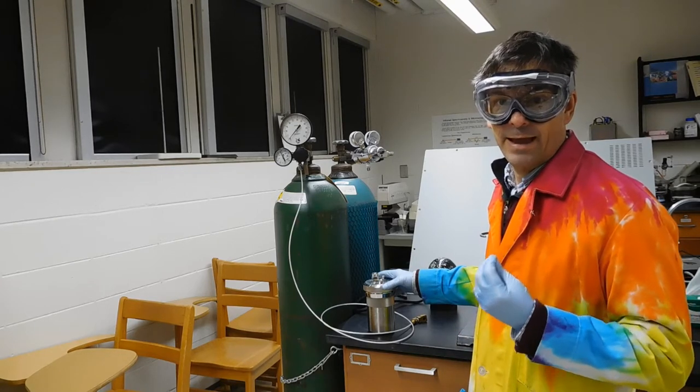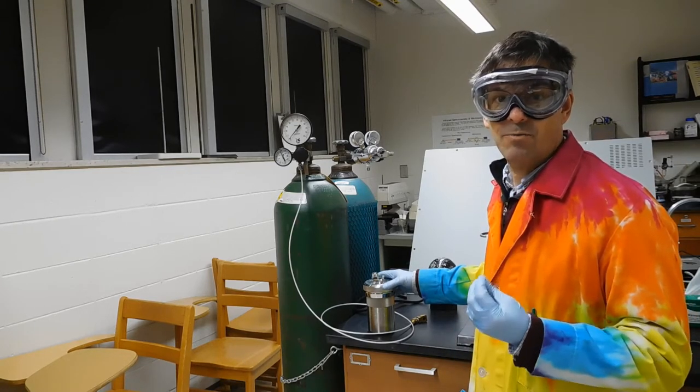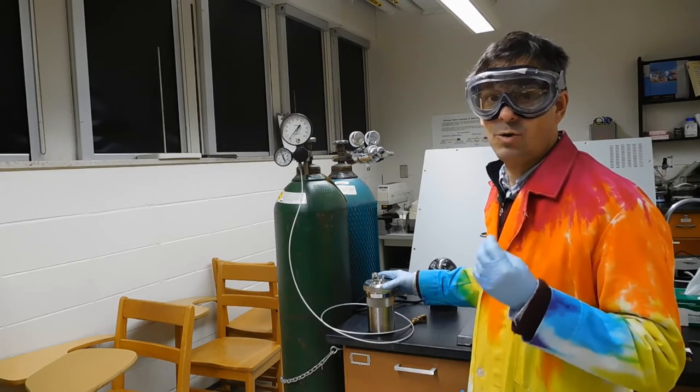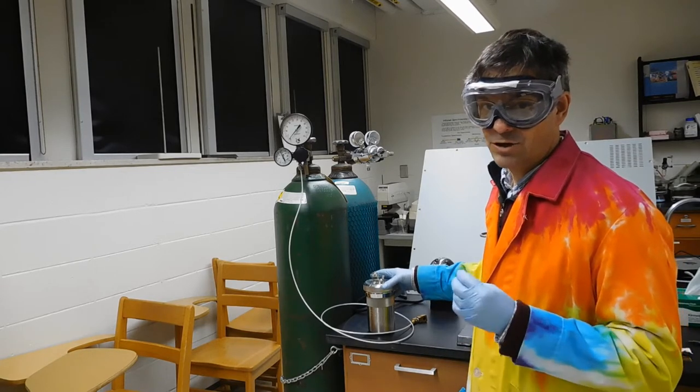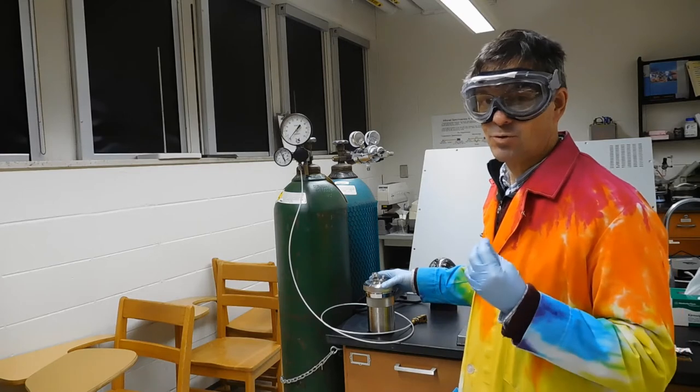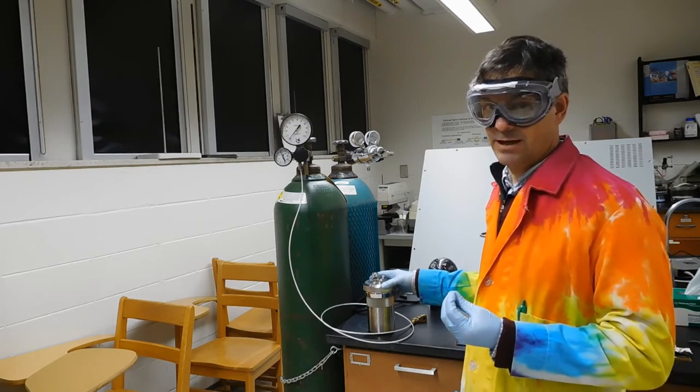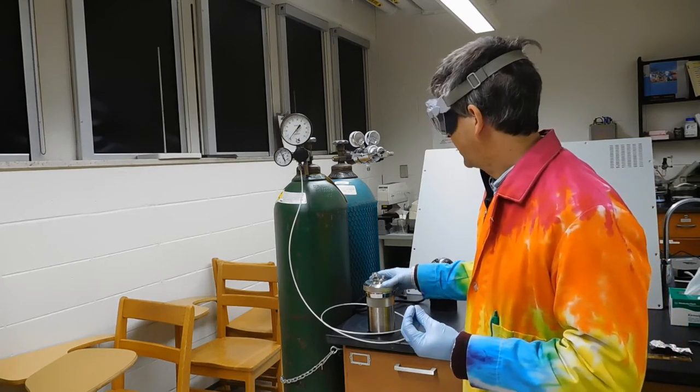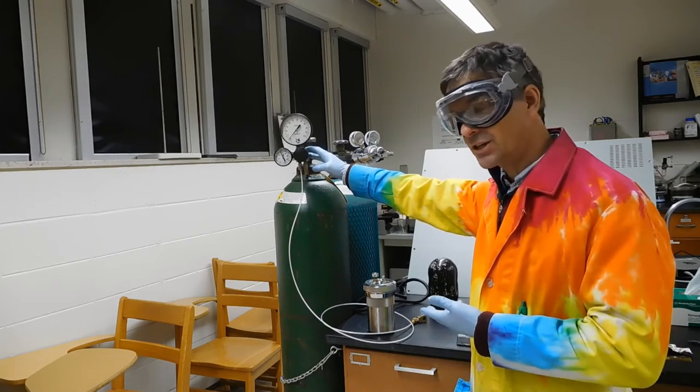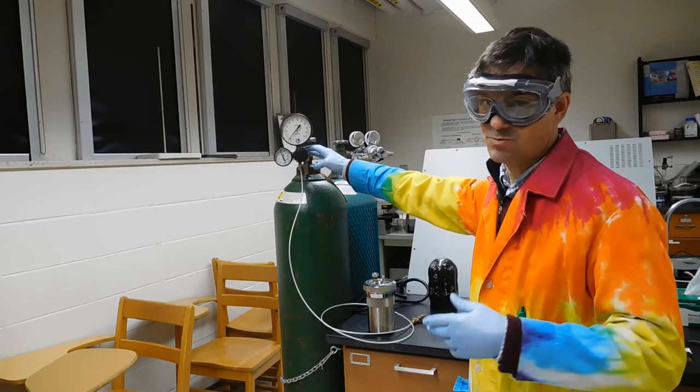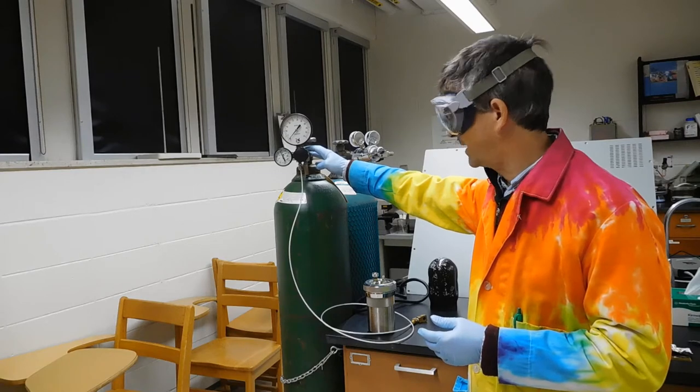To encourage that to happen, we fill the bomb with pure oxygen to a high pressure. We're actually going to end up charging the bomb to 26 atmospheres of oxygen. We do that with a high pressure gas cylinder that contains oxygen instead of nitrogen as we used earlier in the semester.